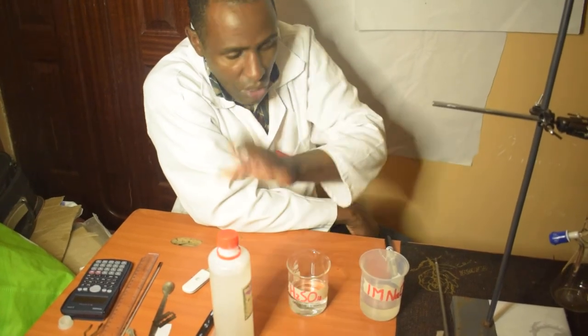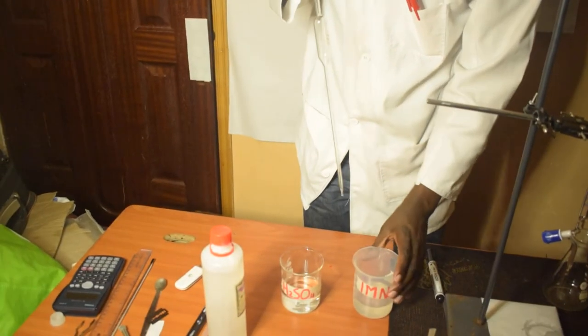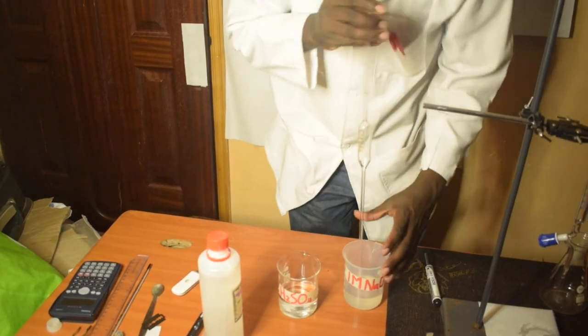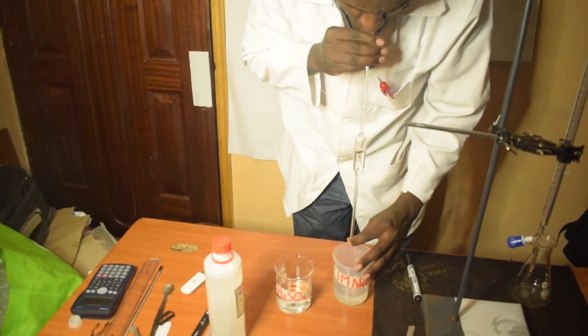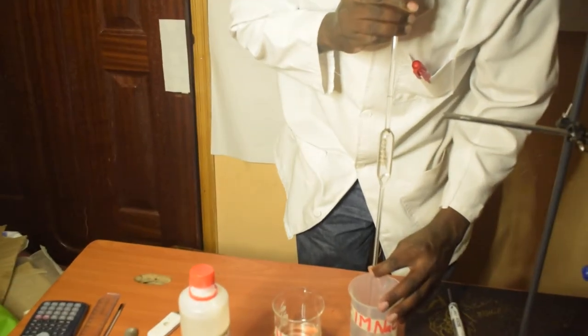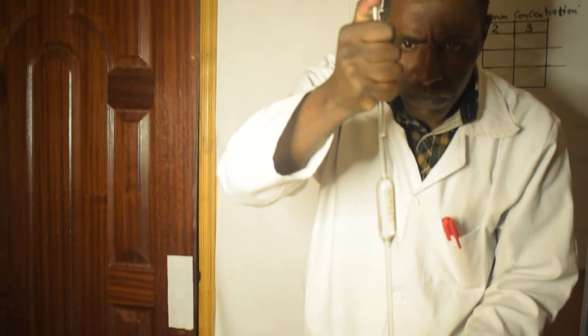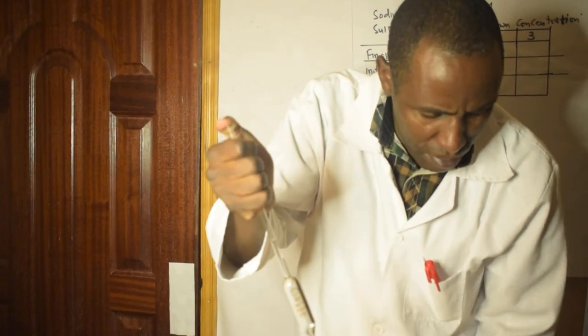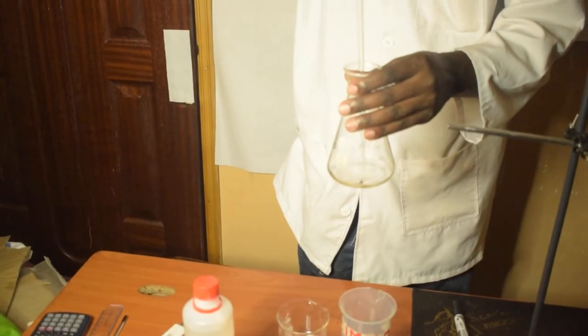The first step here — I'm going to pipette my sodium hydroxide and put it in a conical flask. There I am, I'm going to release it into the conical flask.